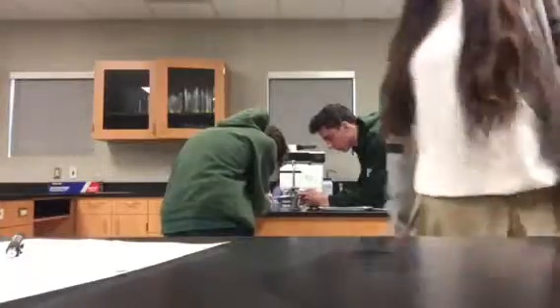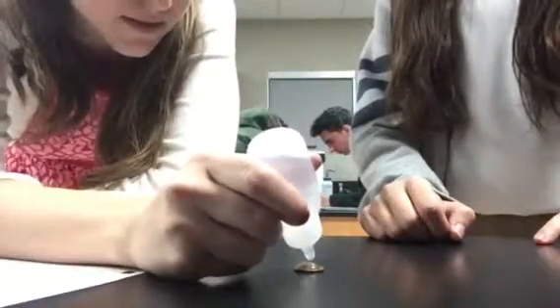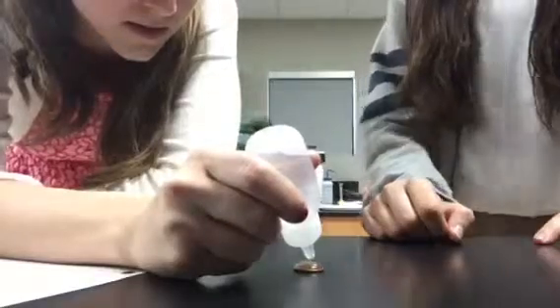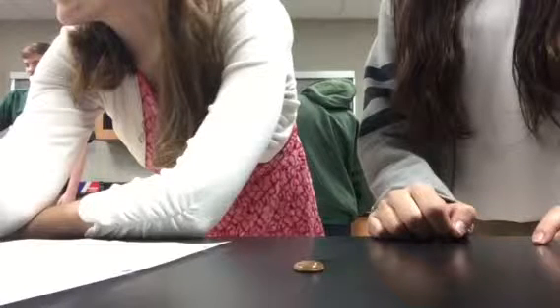okay, so over here Miss Paulina is going to help us, and before the last video we had a little problem with the water drops, but she clearly fit 29 drops of water because, as you can see here, water has a big attractive force, and it was pretty clear to everybody else that, you know, it's pretty strong. And so we couldn't get the last drop of it, but that's pretty much all the video we could get. So yeah.